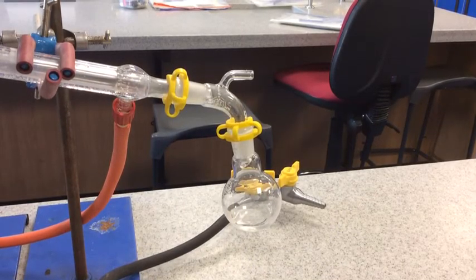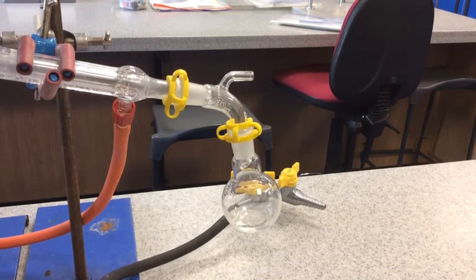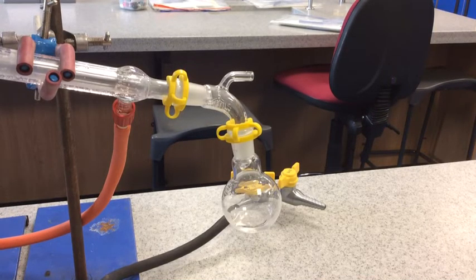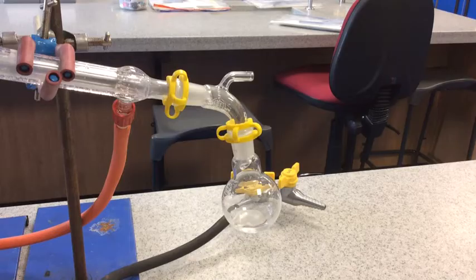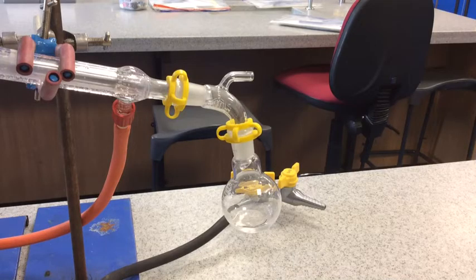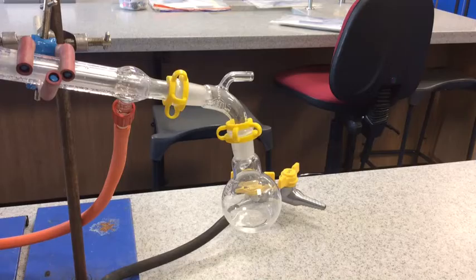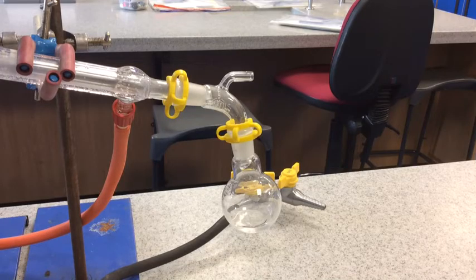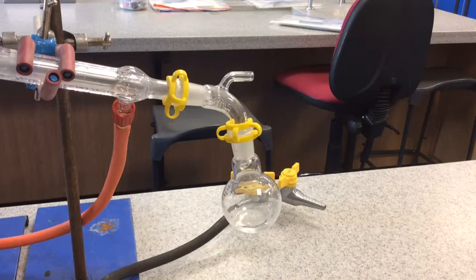I've just zoomed in there on the receiver flask and you can see every now and again we get some clear product, some distillate, some aldehyde formed. Here it is. It must be slightly stuck - here it is coming now.